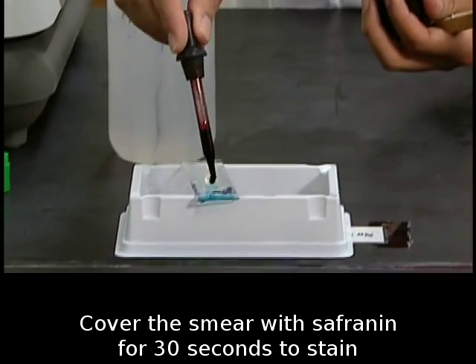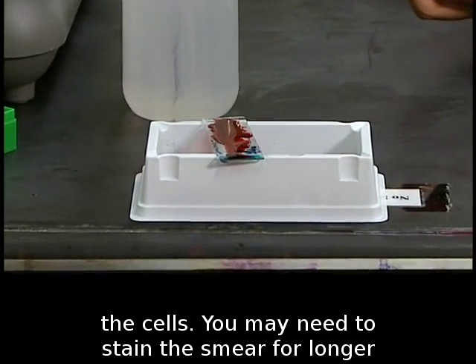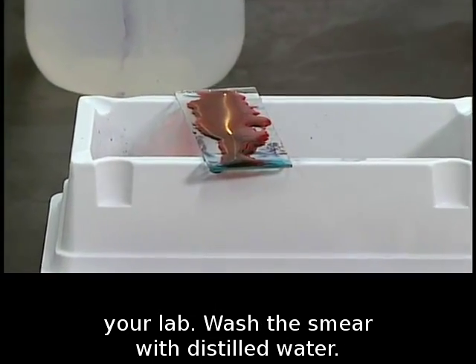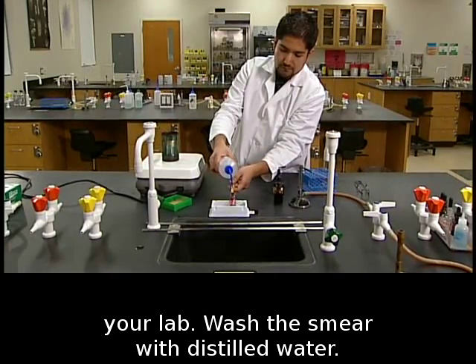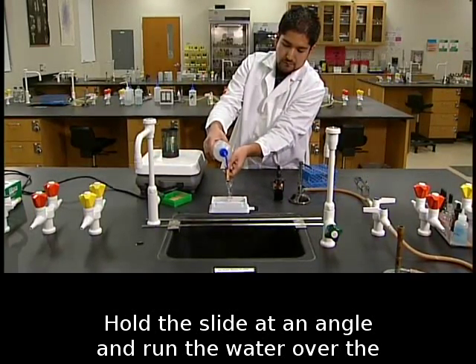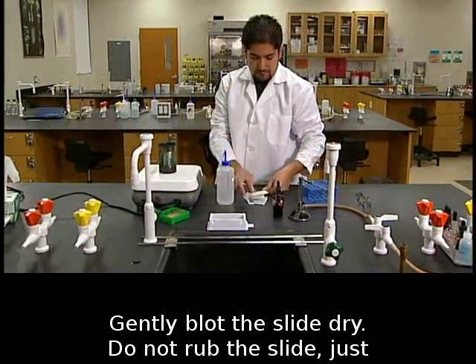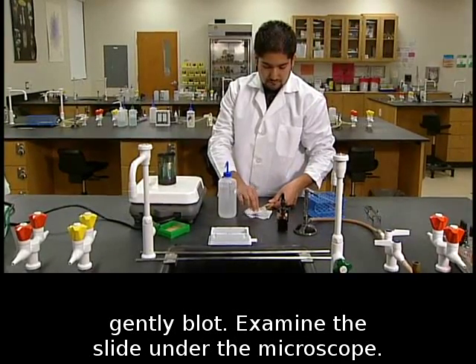Cover the smear with safranin for 30 seconds to stain the cells. You may need to stain the smear for longer than 30 seconds depending on the reagents used in your lab. Wash the smear with distilled water; hold the slide at an angle and run the water over the slide until the water runs clear. Gently blot the slide dry — do not rub, just gently blot.